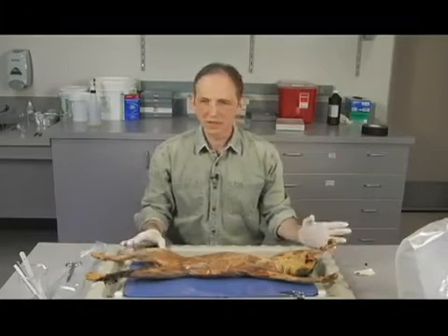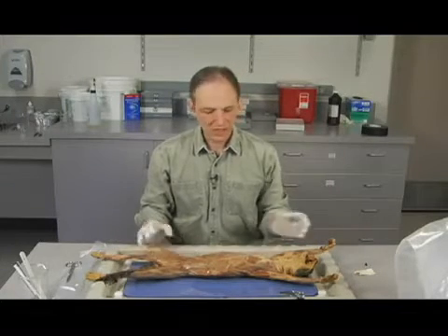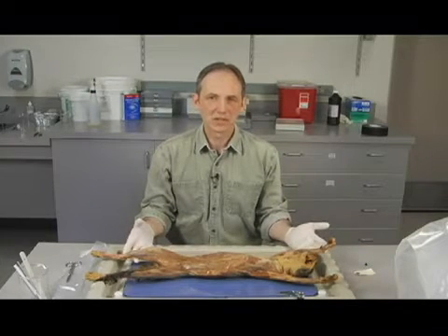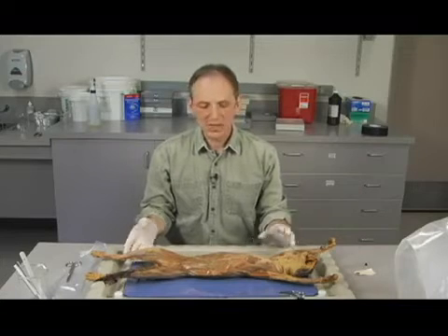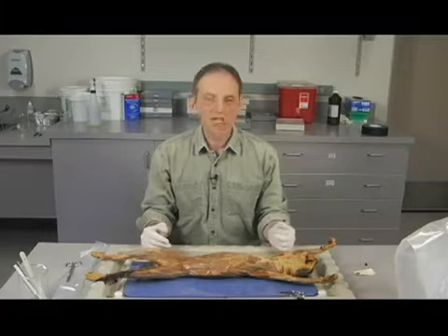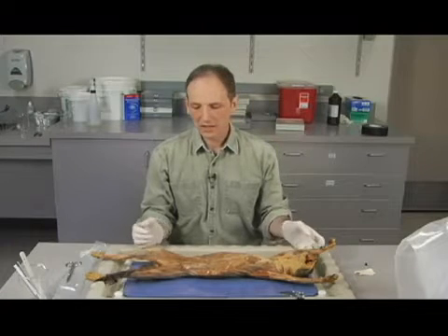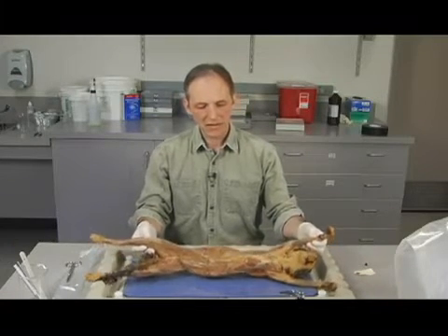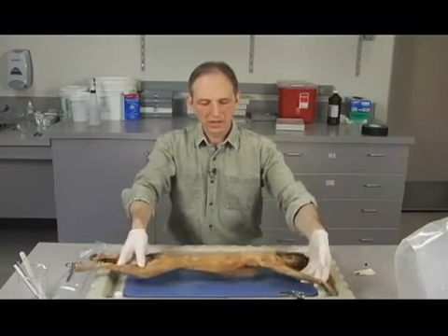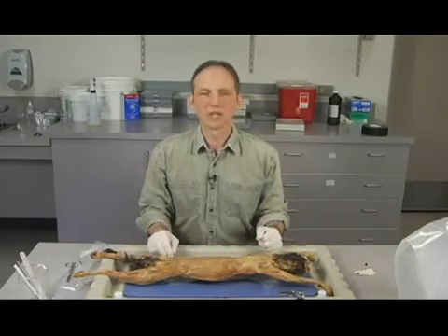Okay, so here's the specimen. Now I guess you can see it a little bit better. As you can see, the cat has been skinned. That's going to save you a lot of work, because some cats that you buy from biological supply houses have the skin on them. You have to take that off, and that takes quite a bit of time. So the skinned cats are good. I try to buy those type of specimens for you. There's a little bit of skin up here around the head and the neck area. We can get a look at the cat now. You can see the tissues. I'm going to turn it over. Kind of see the back. And that's what we're going to be working with.